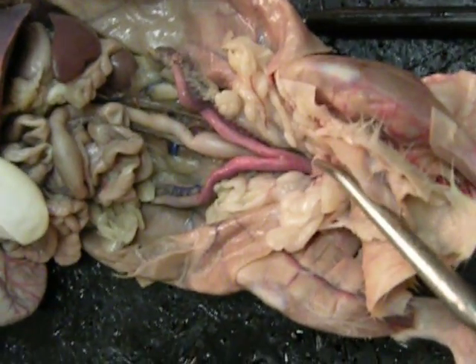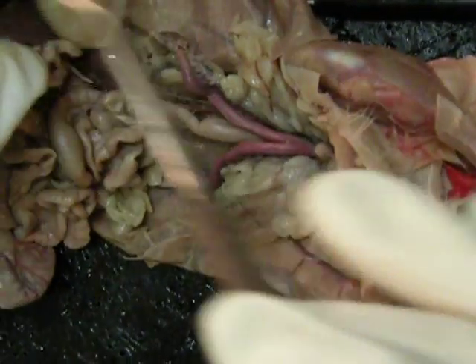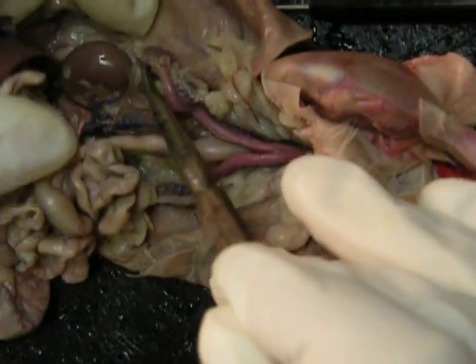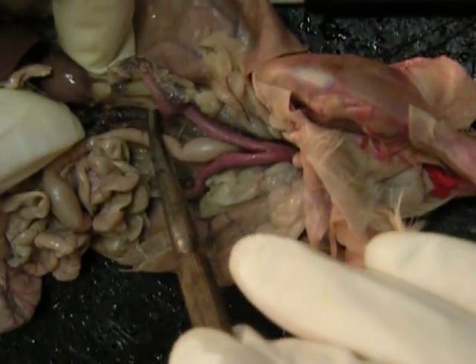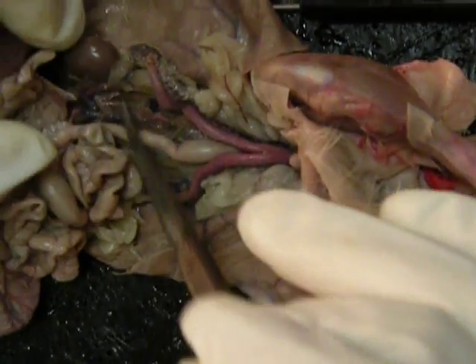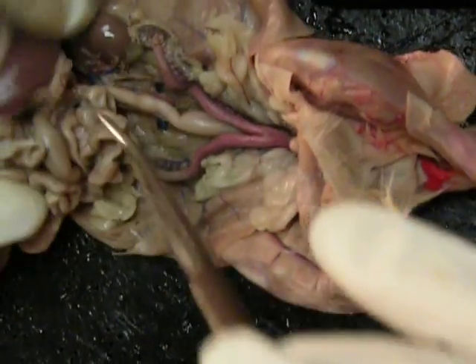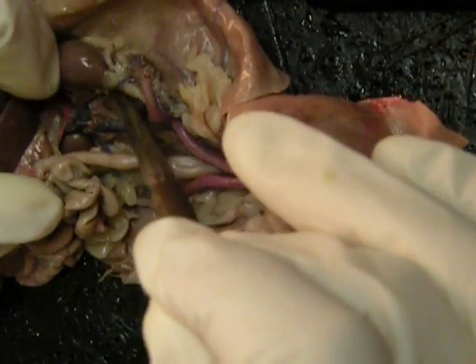This right here is the ureter, and if you ever wanted to see the ureter, you could go to the kidney and kind of follow it down. You'd have to kind of dissect the kidney, but you'd find it and could follow it all the way down.